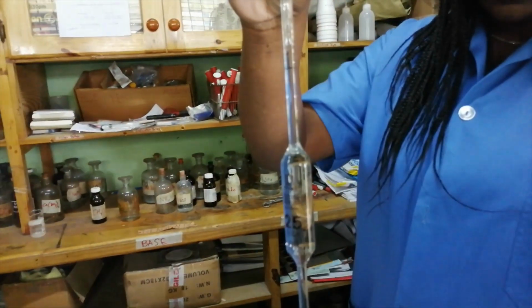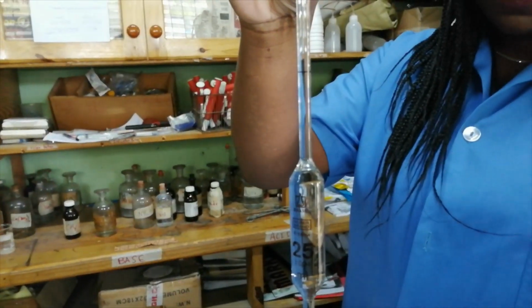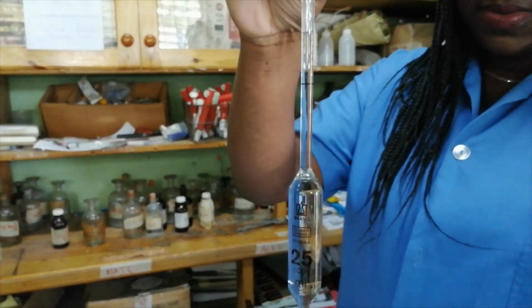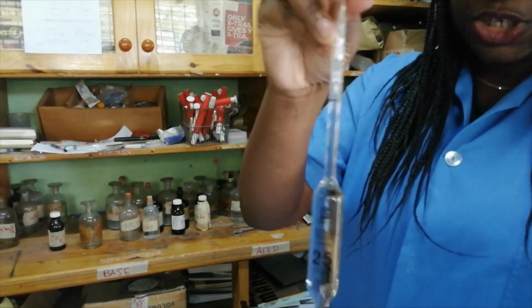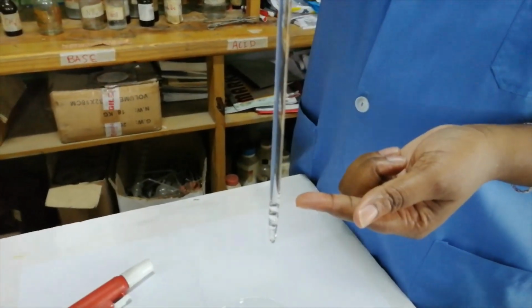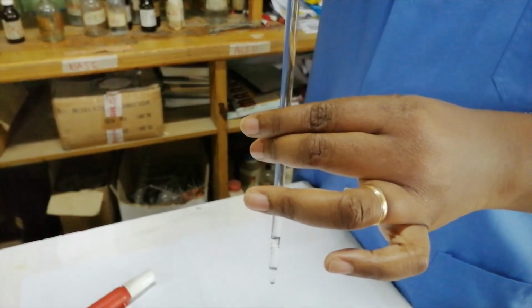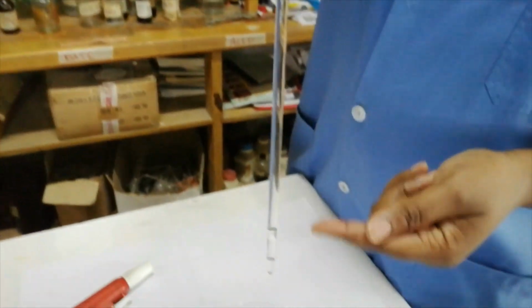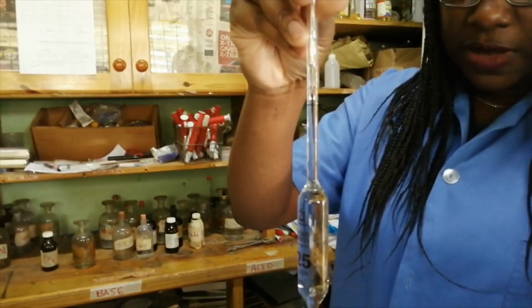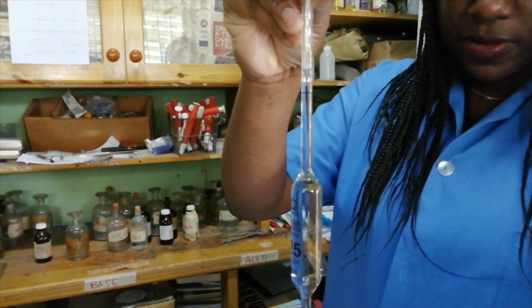And I'm going to gently move my index finger across. Remember, you're supposed to use your index finger, not your thumb. At this point in time, we're not supposed to jerk the pipette because if you see, I've introduced air bubbles in there. So you're not supposed to jerk the pipette when you're doing that. That air is occupying that volume that the liquid should be occupying. So of course, I'll have to get rid of that air bubble or those air bubbles.